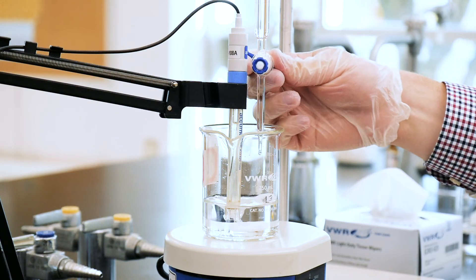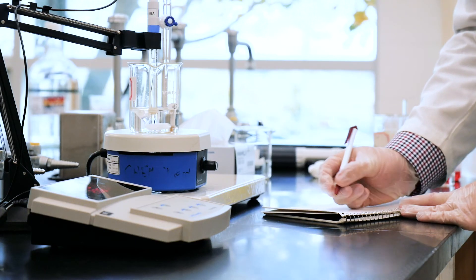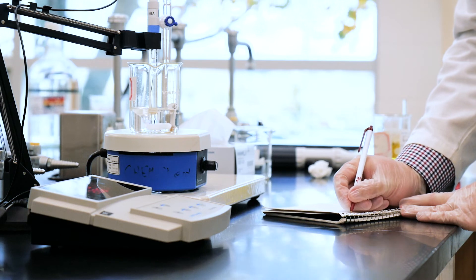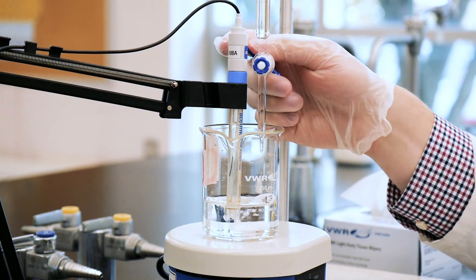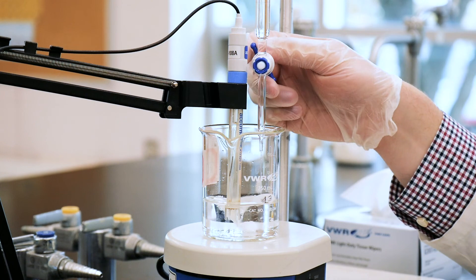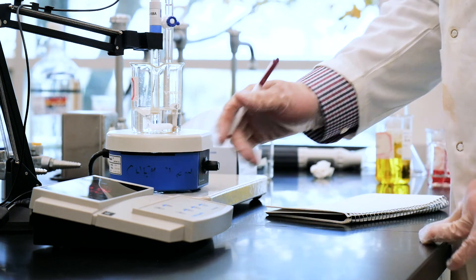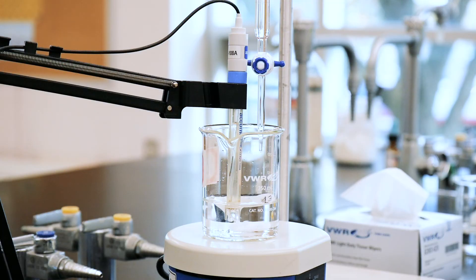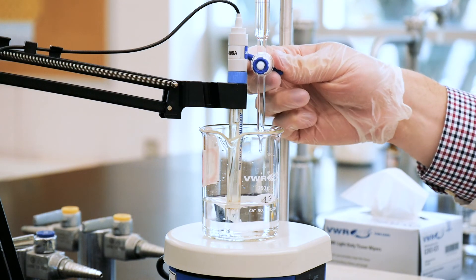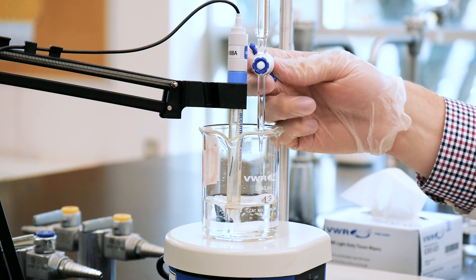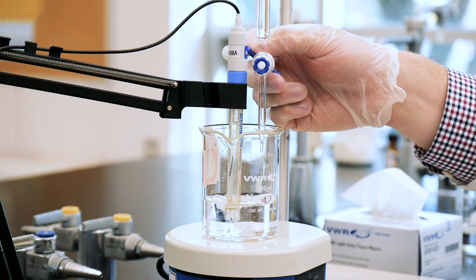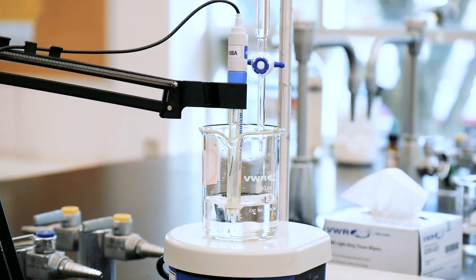Add about 1 ml of the NaOH solution. Record the precise volume and the resultant pH. Continue with these 1 ml additions of NaOH solution and keep a record of both the resultant volume according to the burette and the corresponding pH. As the endpoints are approached, and spoiler alert, they'll be about 21 ml and 42 ml respectively. Make smaller additions of the NaOH solution. Continue these additions until well beyond the second endpoint.